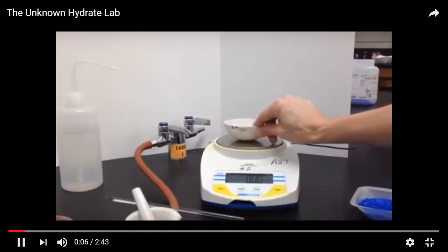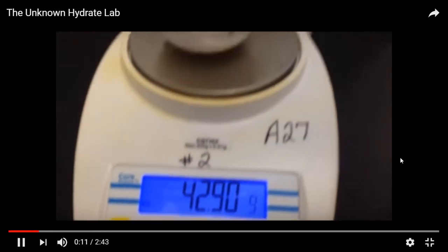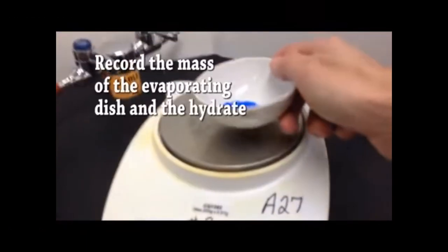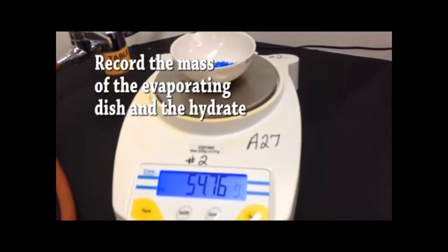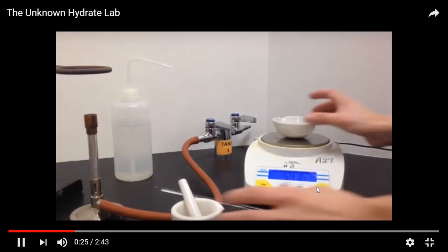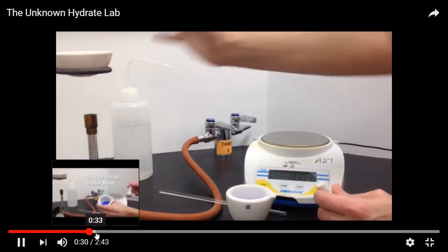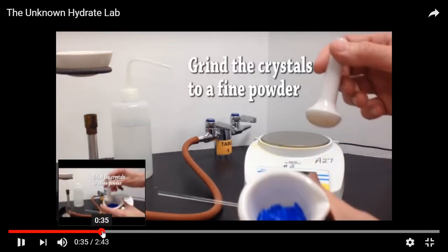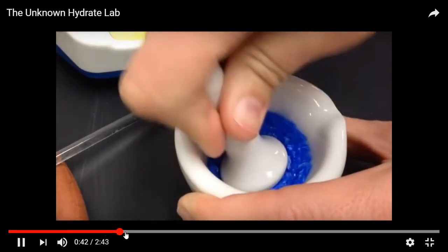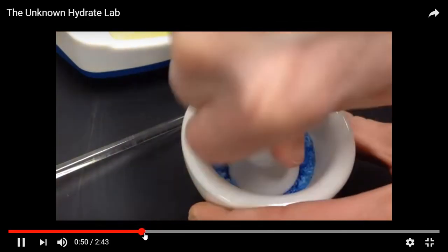So here's copper sulfate. We don't know what the amount for the hydrate is. So just watch what they're doing. They're just going through the process of the lab. They mass the evaporating dish. They're going to record the mass of the evaporating dish with the hydrate sample in there. That's 54.76. I'm just going to fast forward through and grinding it. It's just increasing the surface area to get the water to evaporate more easily.